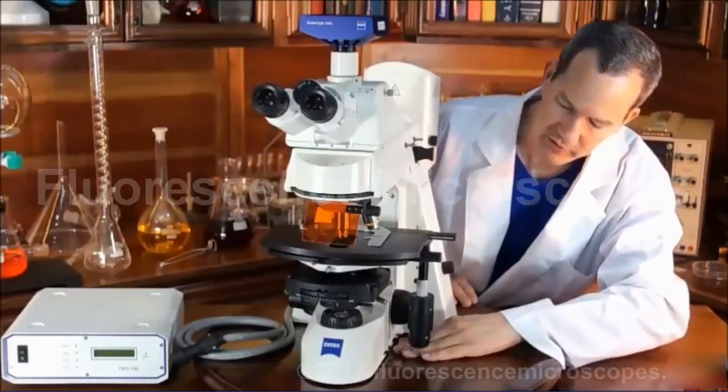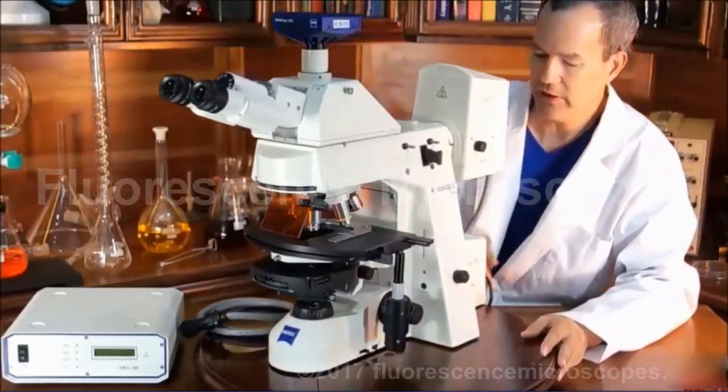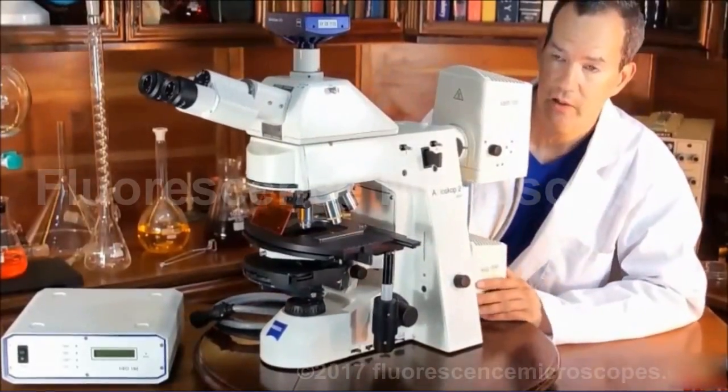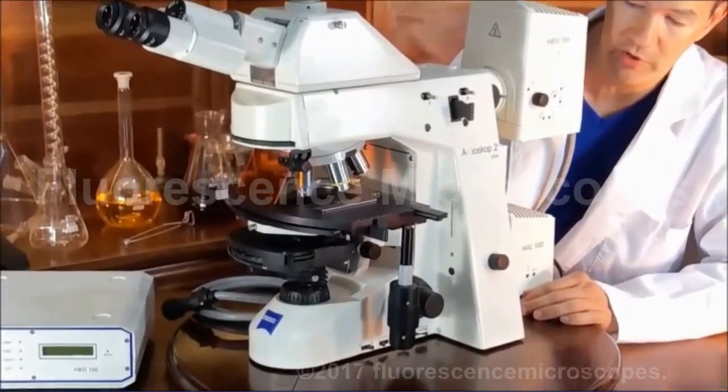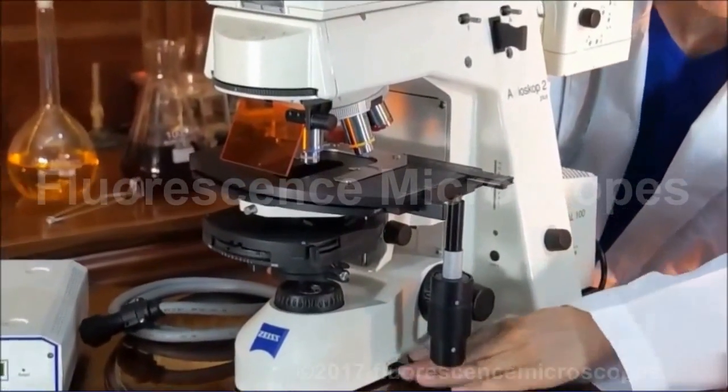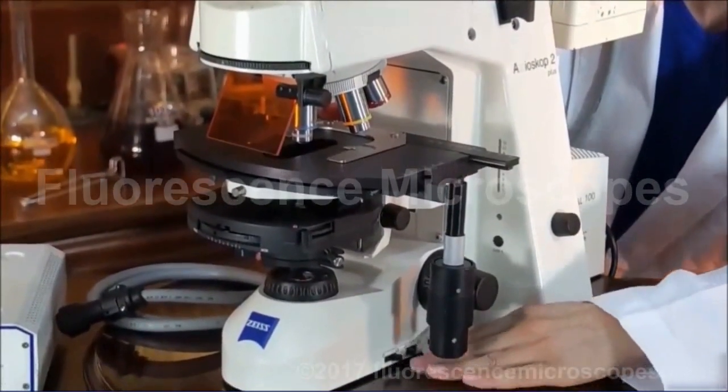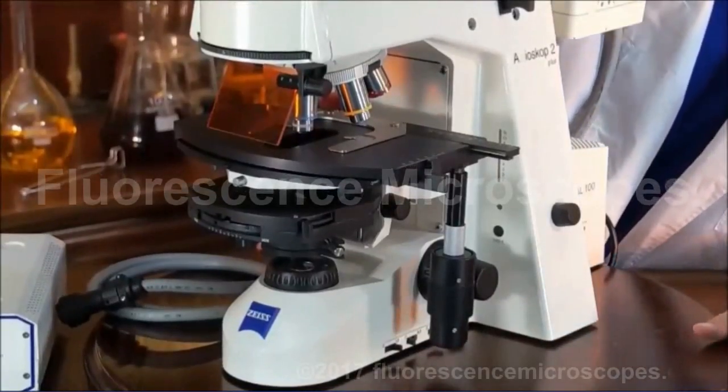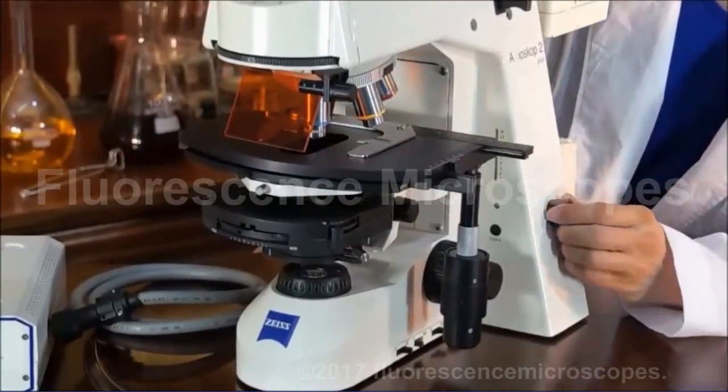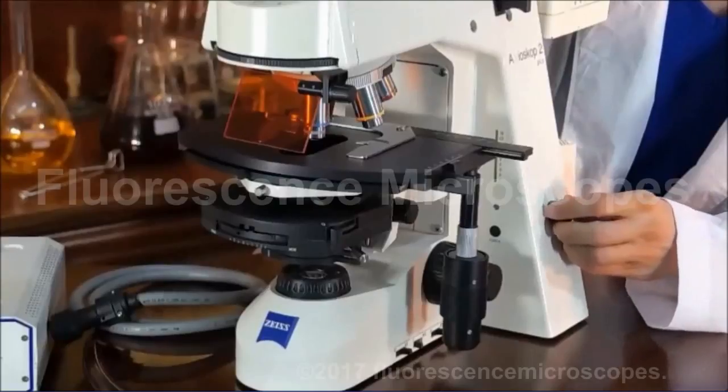Now the neutral density filters are good because if you want to decrease the intensity of the light while maintaining your color temperature, then you use the neutral density filters. You can use them in combination as well. And you can also turn down the intensity, however, that changes the color temperature of the light.